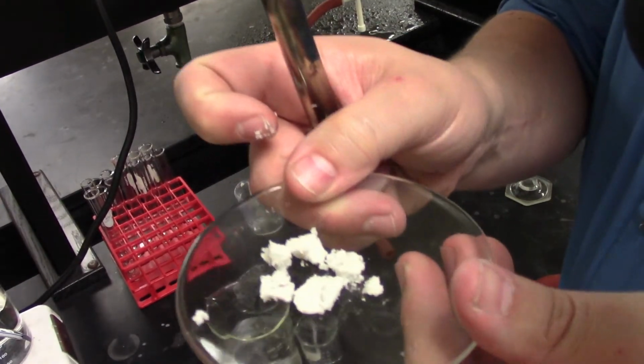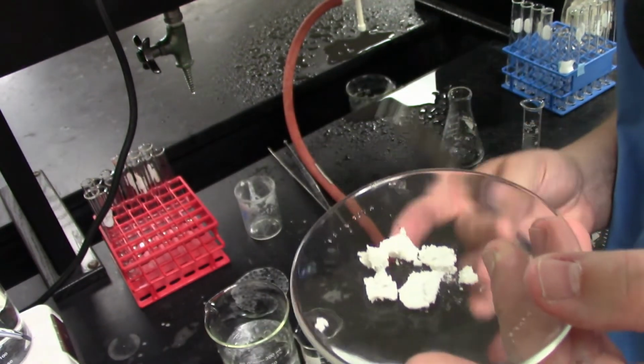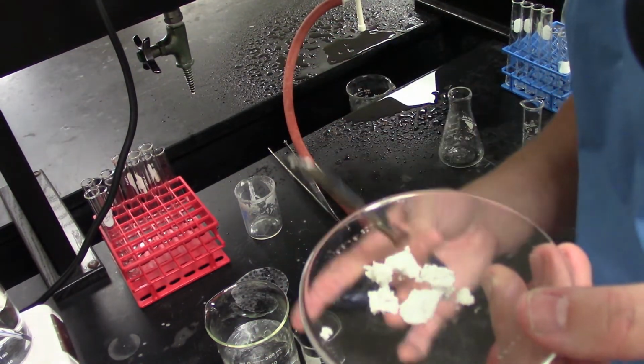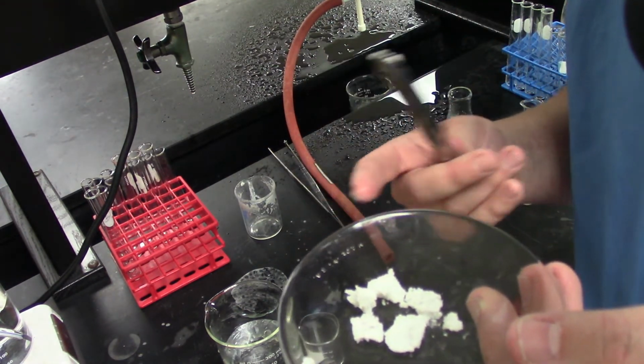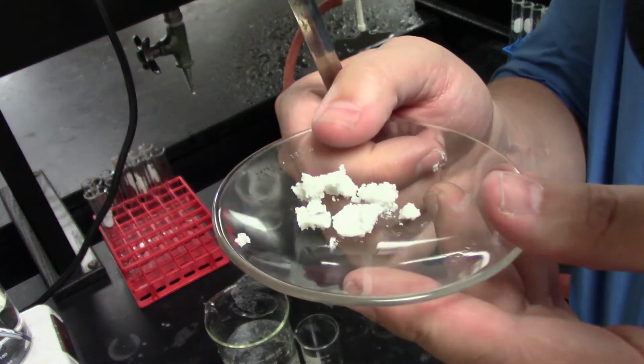All right, so there's my isolated product there. I got 1.58 grams of material. Now, we're not going to really worry about yield here because palm oil is a raw material, and so we'd actually have to do an assay or an analysis of it to figure out what composition we'd expect. There are a lot of materials that we expect to come off this material. We also expect to have various losses, but this is what we'd expect for palmitic acid.